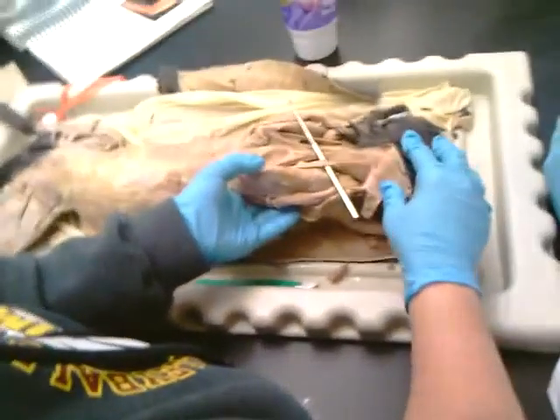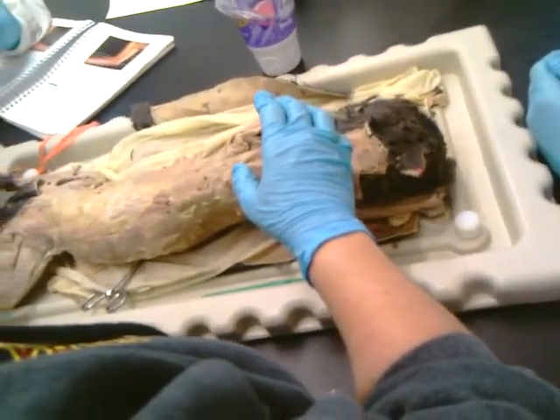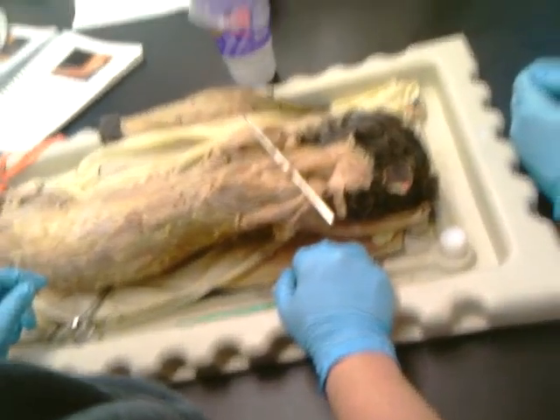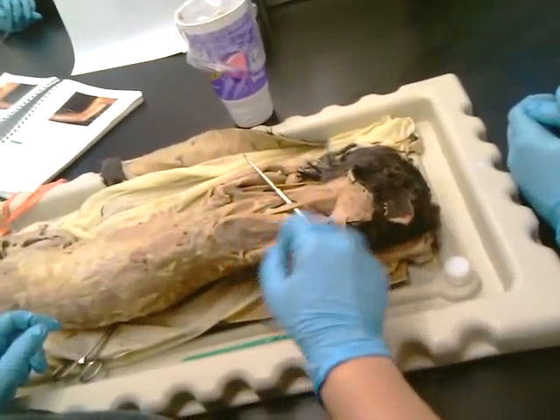Rhomboid? Part of the rhomboids, but it's not. Let's look on our list. Well, heck, it's not on your list. No, on mine. Don't need another one.